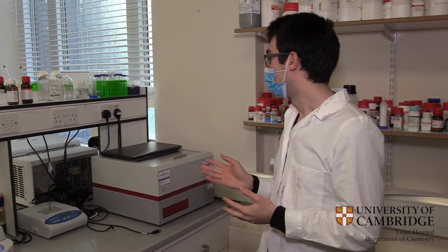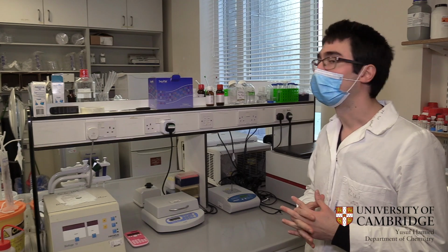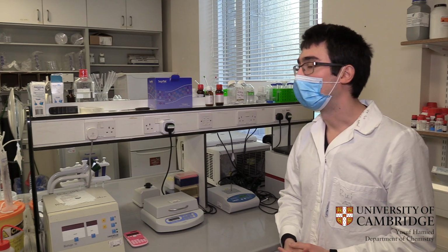So in our lab, we also have the capacity to do all sorts of assays using this instrument. So it is also suitable for people who want to focus their work more on the biochemistry or biophysics side of things. And for our biological work, we also have 2 different kinds of centrifuges. The one at the back is a bigger one that you can use for 50 or 15 milliliter tubes. And we have a smaller one here that can be used for Eppendorf tubes.